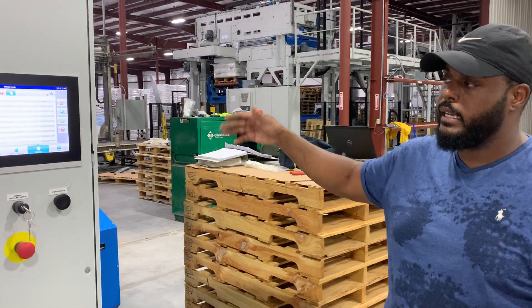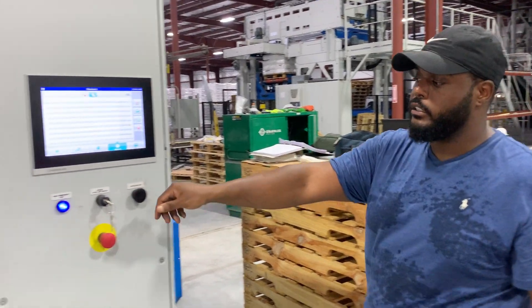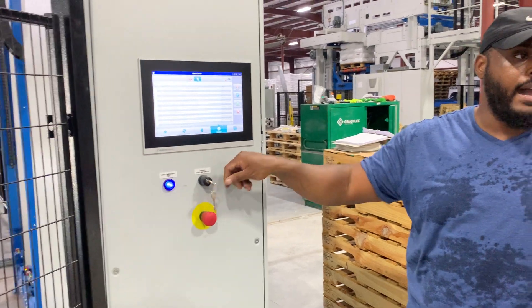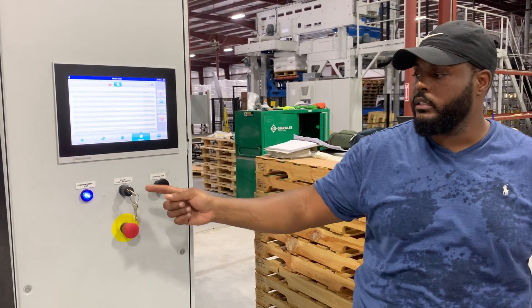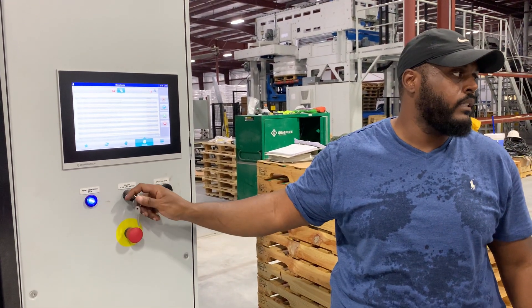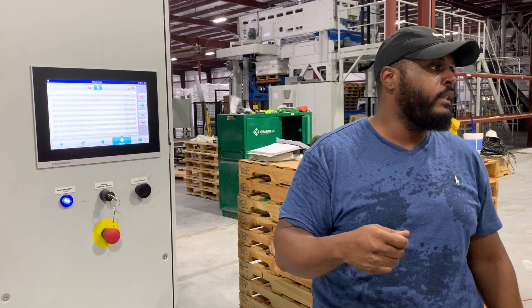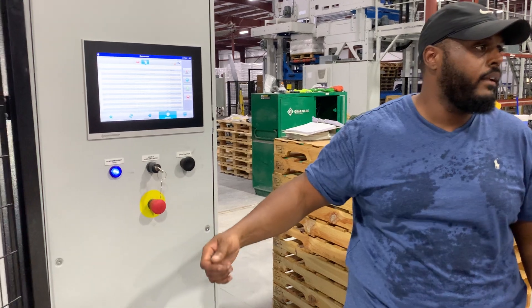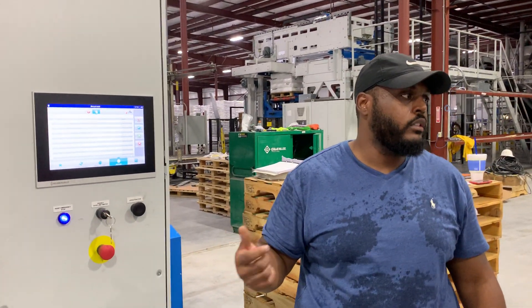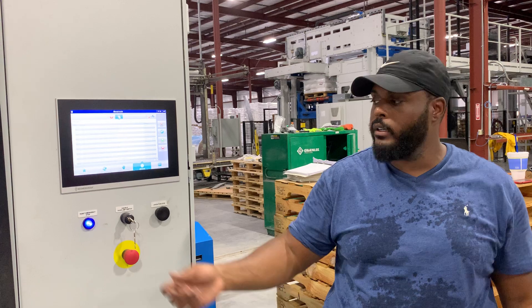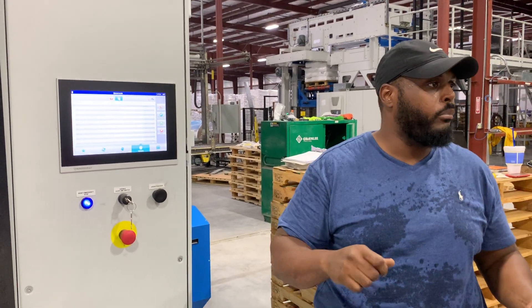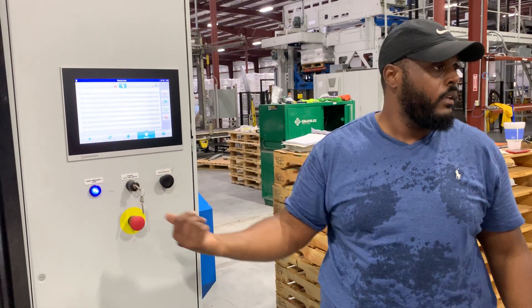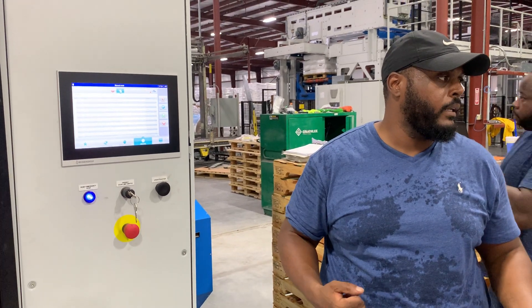Normally that's not possible. You've got this door limit switch right here that allows you to get in there. I would say the person in charge of maintenance should take this key with them so that a regular person who doesn't have the skills to work inside the cabinet can't go in there.